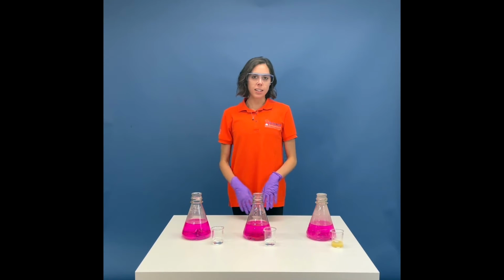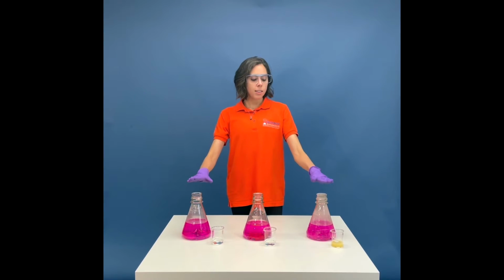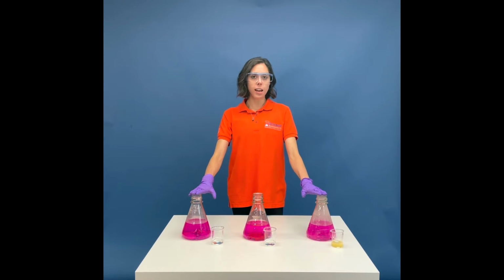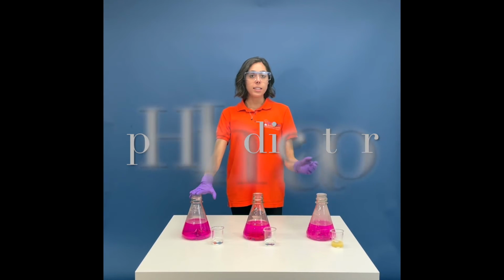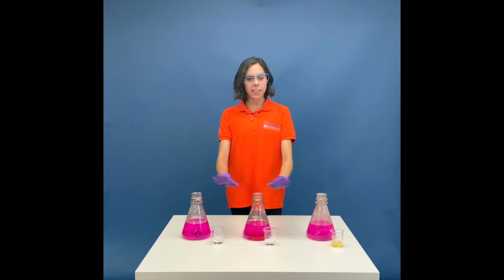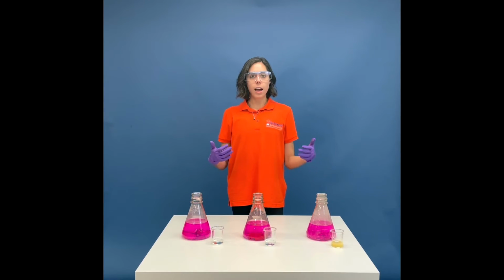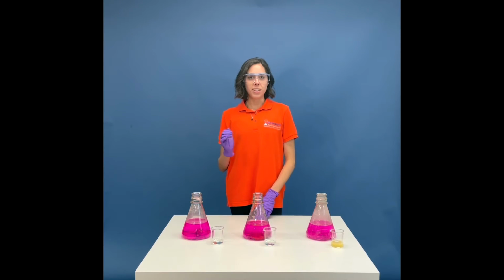So now we have an idea of acids and bases, I'm going to show you guys these 3 flasks here. These flasks contain 3 things: water, sodium hydroxide, which is a very strong base, and phenolphthalein, which is an indicator. These 3 have a basic solution shown by the bright pink color of the phenolphthalein that comes in contact with the sodium hydroxide. So I want you guys to think about what I might do to turn a base into an acid. And if you guess using an acid, you are correct.